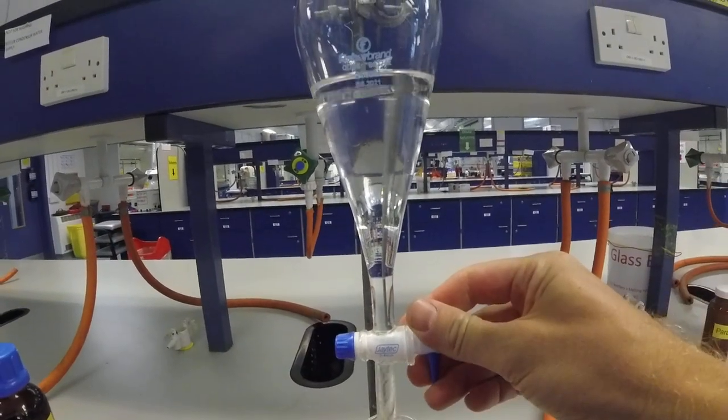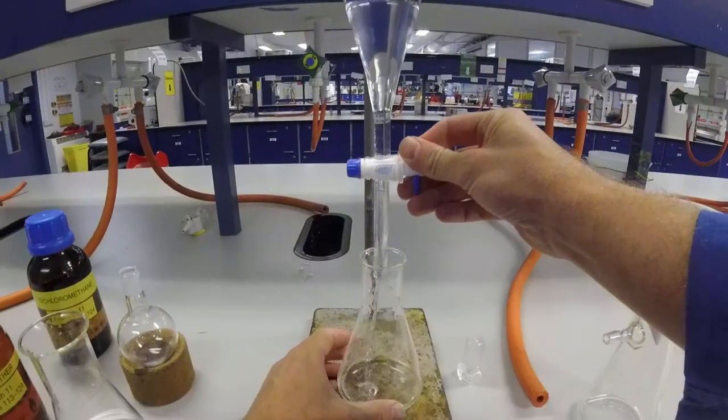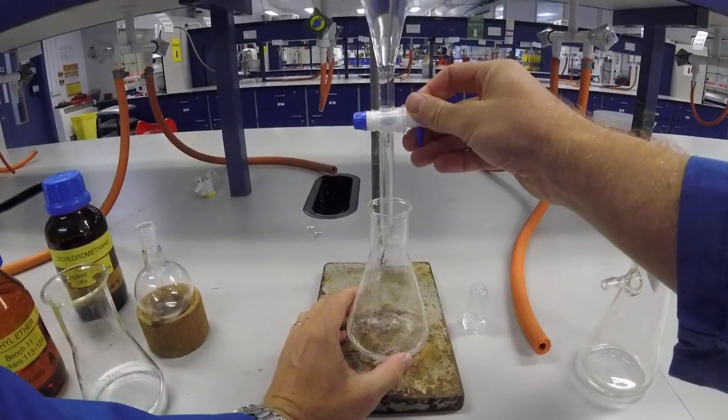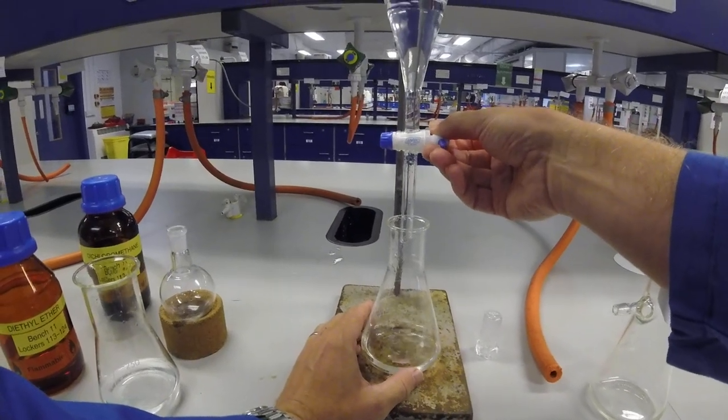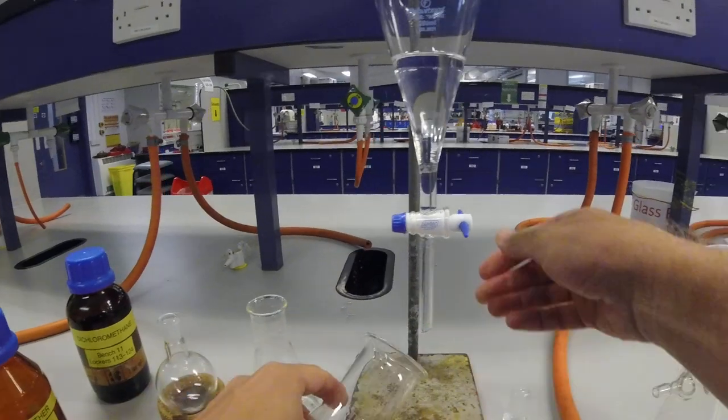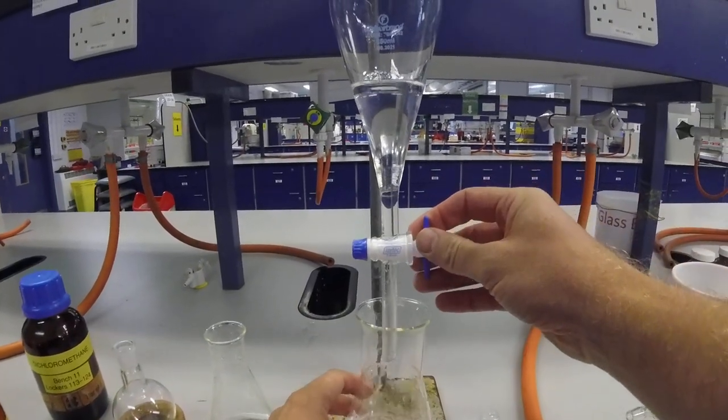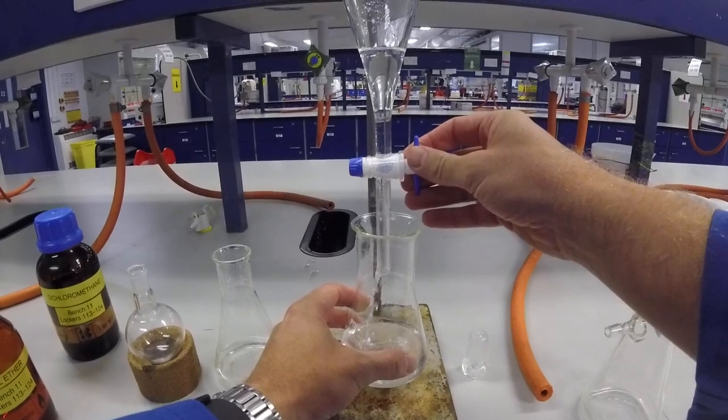I'm going to pop that bottom layer now into the conical flask. And the top layer is added to the original organic layer as well.